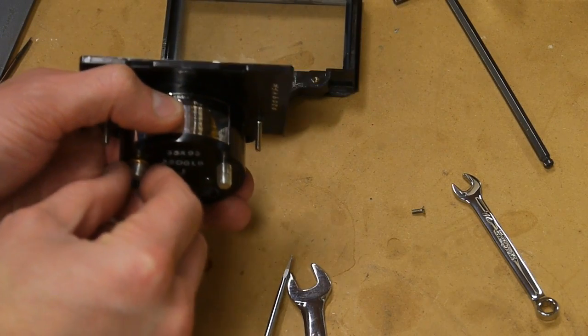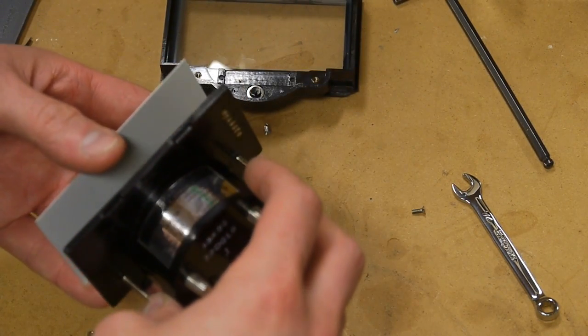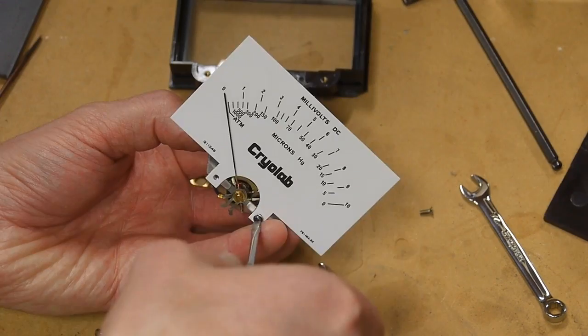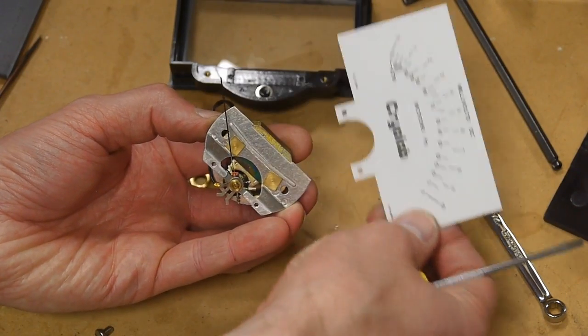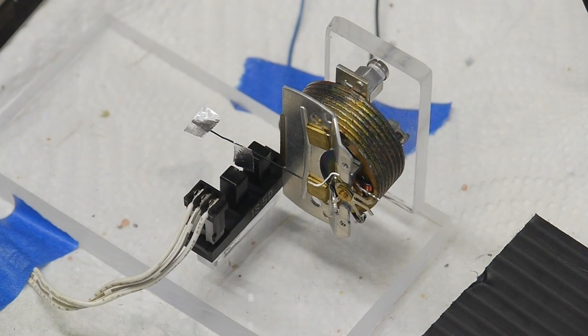I started by taking apart an old panel meter that came out of a broken vacuum gauge. One thing to keep in mind is that most panel meters are 1 milliamp full scale, and the DC resistance of these is often about 50 ohms. So despite having meters for different volt ranges and different current ranges, generally it's just the resistors that are changed, and the actual movement is almost always 1 milliamp. Although for really sensitive current meters, you can get 100 microamp or even more sensitive ones.